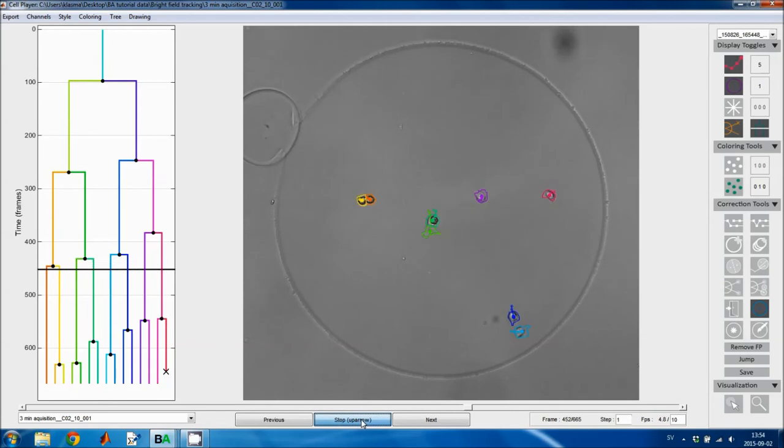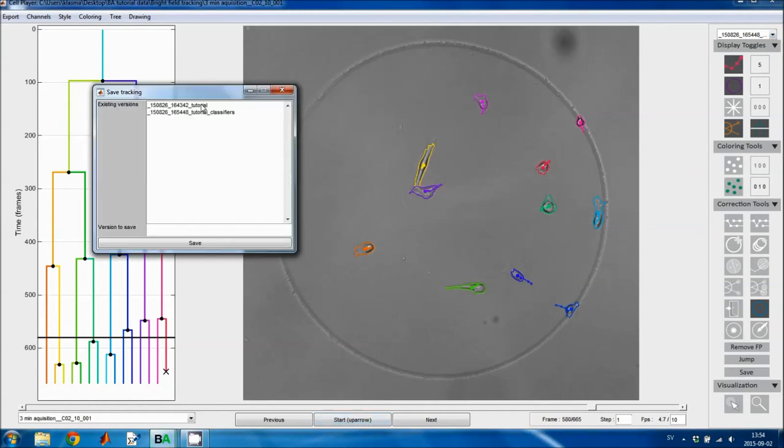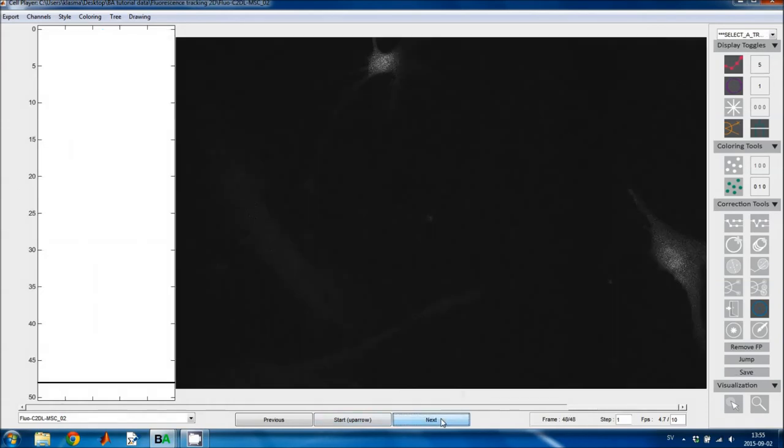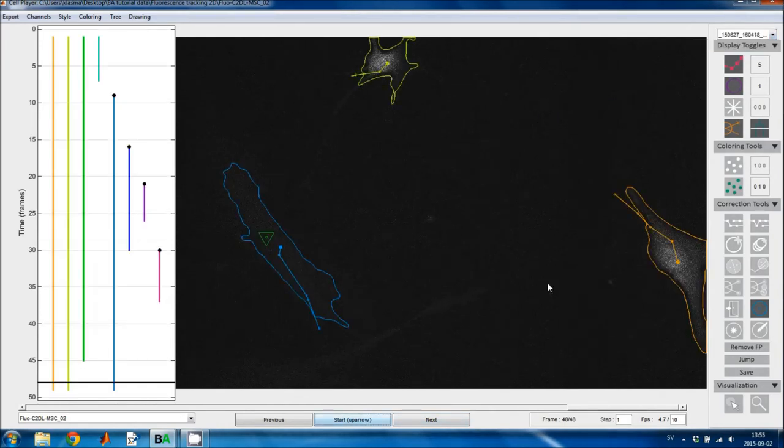Now we can see what happens to the two daughter cells. Well, it looks correct. I don't see any more tracking mistakes here. Now I'll just save the corrected results here. And I normally just add corrected to the end of the tracking result label. Now the results have been saved, and we'll move to the next image sequence, because this has more mistakes that we can correct.